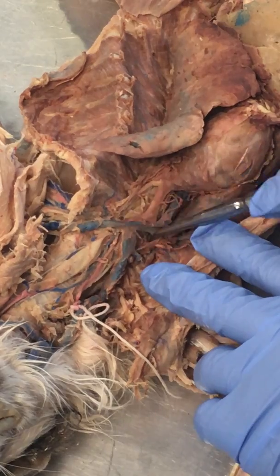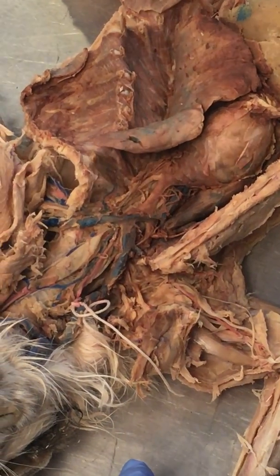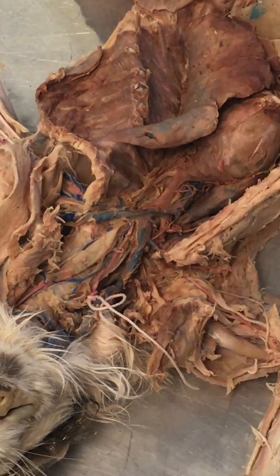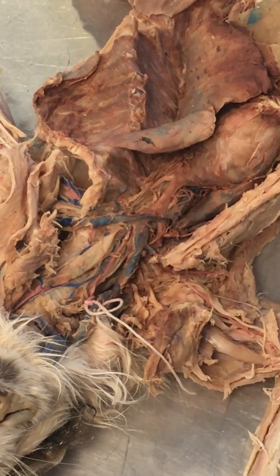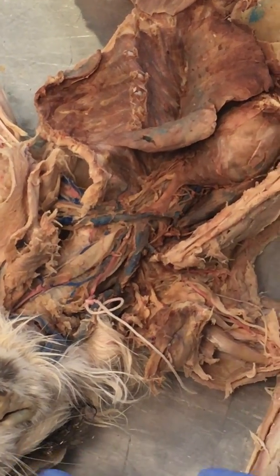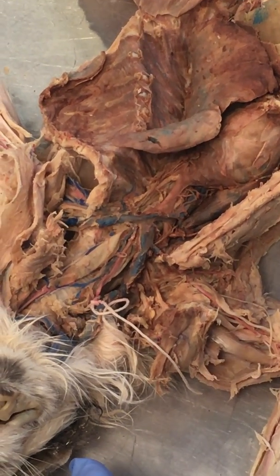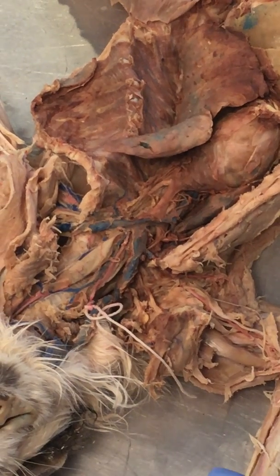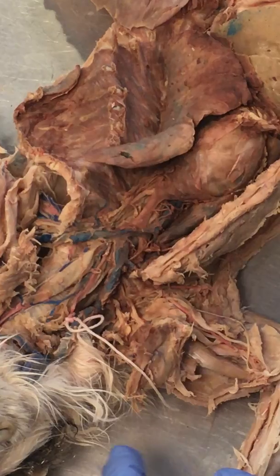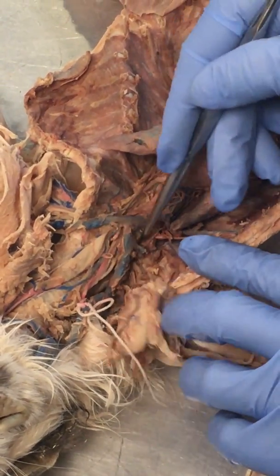Now, vertebral arteries are going to go into that transverse cervical foramen, and remember, if you look at the cross section through a cervical vertebra, it's got the central canal where the cord sits, but it has these two little holes on the side, and all 7 cervical vertebrae have those. Those little holes on the side are called the transverse cervical foramen, and they are the holes through which the vertebral arteries pass. Okay, so that's a specific characteristic of cervical vertebrae that we don't see with the other vertebrae, because the vertebral artery travels up in there.